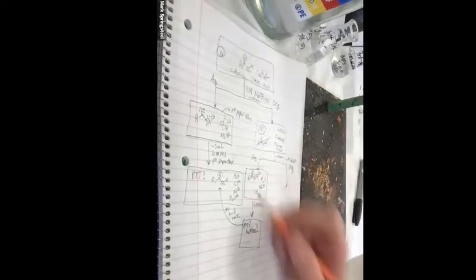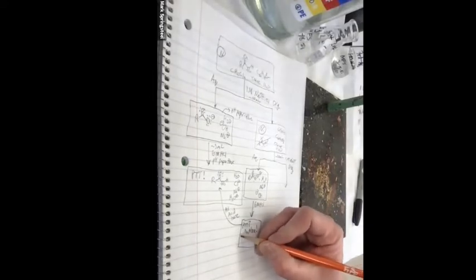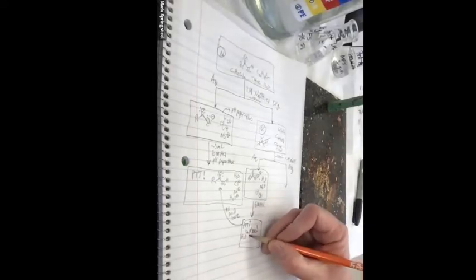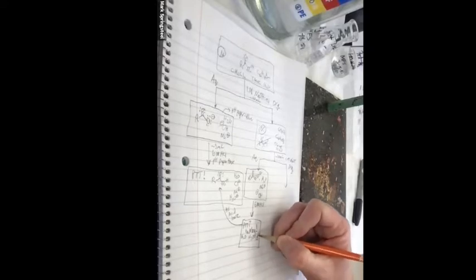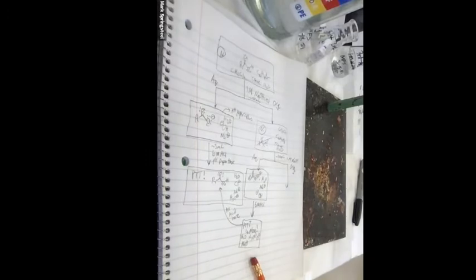So I didn't have this. So what is in here mostly? Water, hydronium, chloride, and sodium. Yeah, so I can dispose of that, quench it with some sodium bicarb, and put it in the waste container.